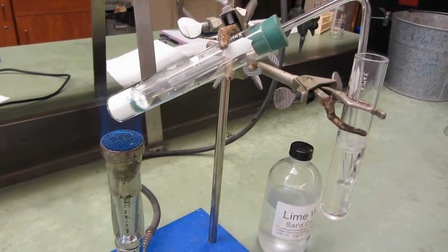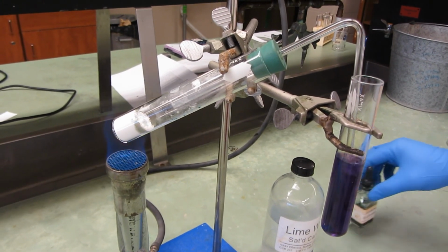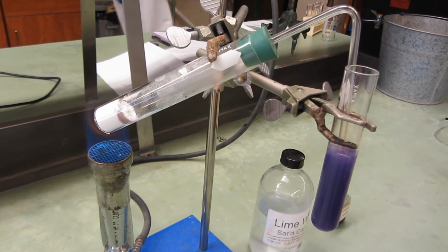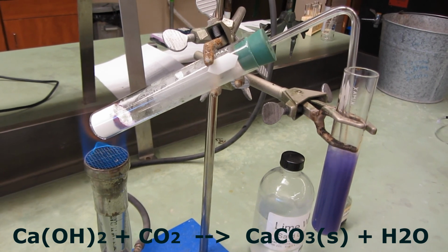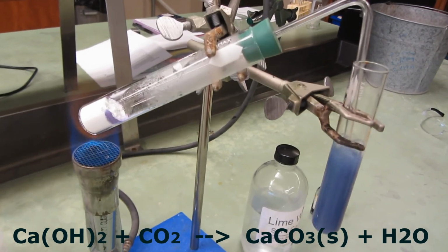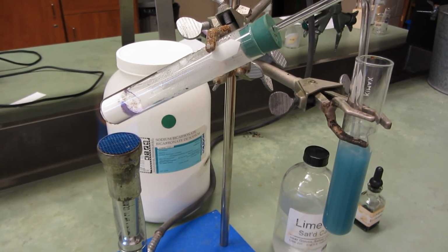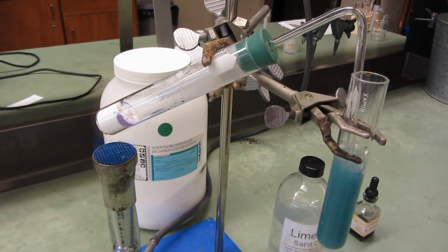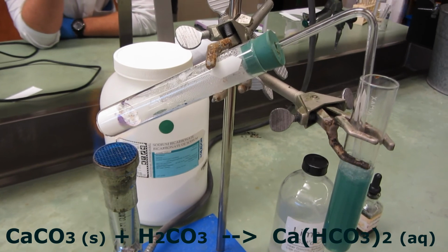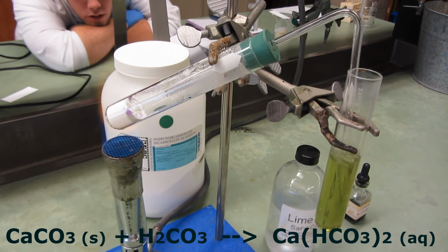I'm going to add some universal indicator here. The solution will turn purple because calcium hydroxide is a base. But it also went cloudy, and that's not from the indicator. It's from the carbon dioxide gas reacting with the calcium hydroxide and actually precipitating calcium carbonate. Now I've sped this up a bit, and if you watch, you'll notice the color changing from purple to blue to green and ultimately a hint of yellow as the calcium carbonate is being neutralized by the acidic carbonic acid. But also you see the calcium carbonate dissolve, forming soluble calcium bicarbonate. So this is an acid-base reaction.